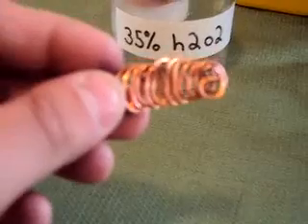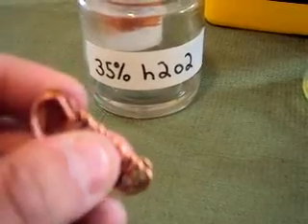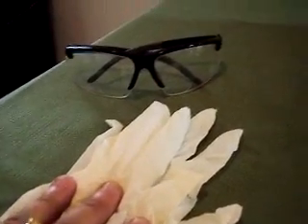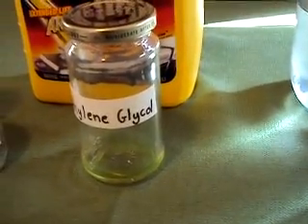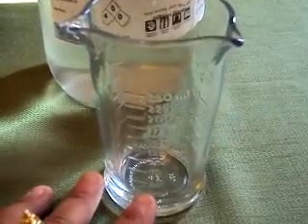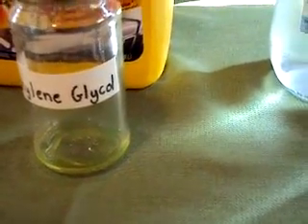I'll be using this copper coil here — 5 grams. I've just coiled it and flattened it out. That's what I will use in the reaction. As always you're going to want safety gloves and safety goggles. If this experiment works we will not only have no fumes evolved from the base metal dissolving, but it will also take half of the normal amount of nitric acid to dissolve this base metal.